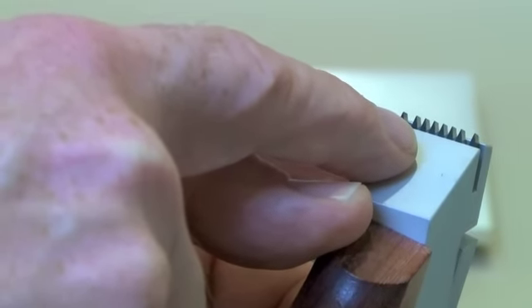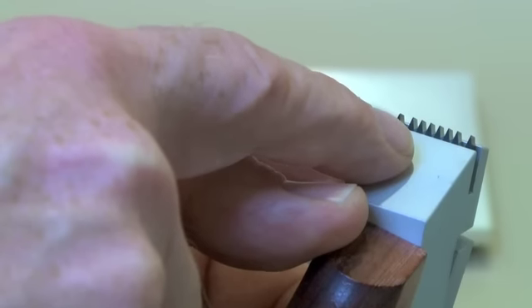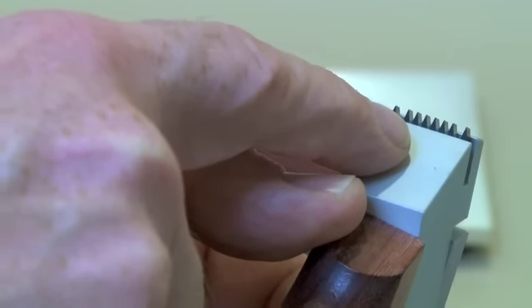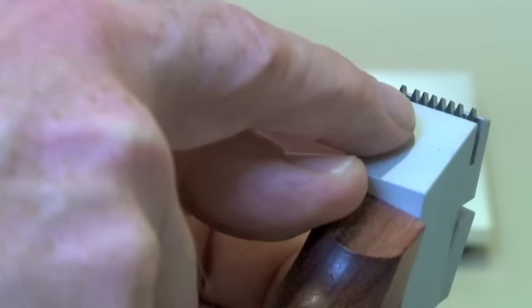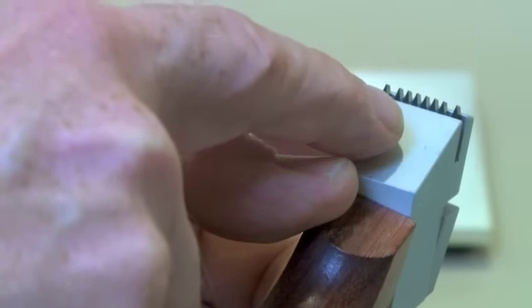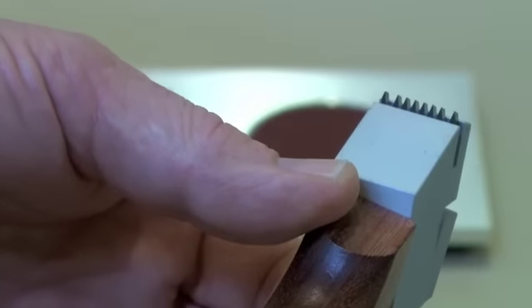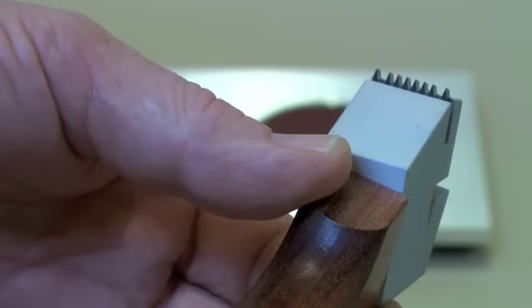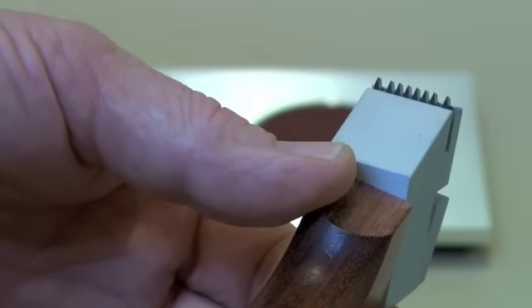We are going to make one cut all the way through the coating to the substrate in one quick motion. Then we are going to rotate our sample 90 degrees and make another cut. Hence the crosscut action.